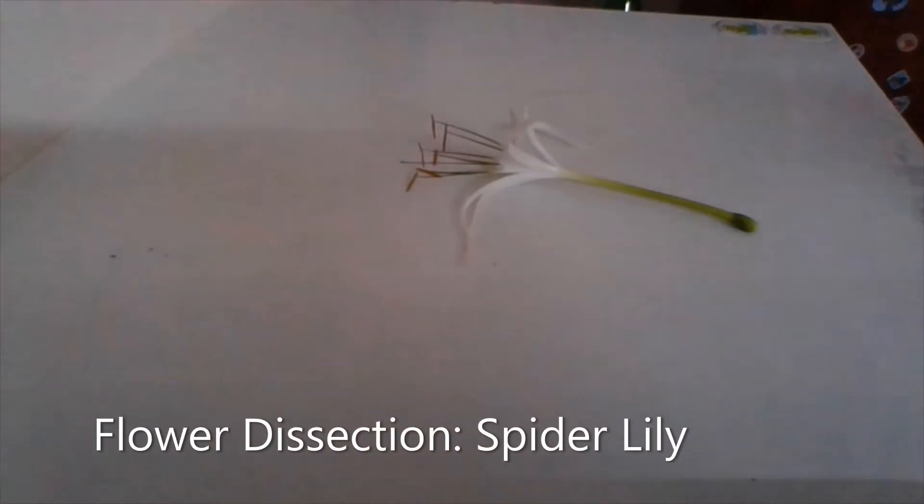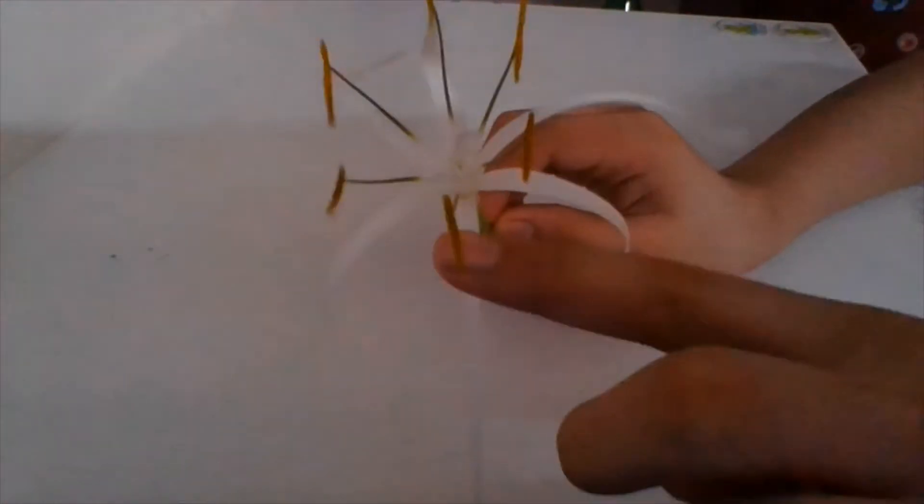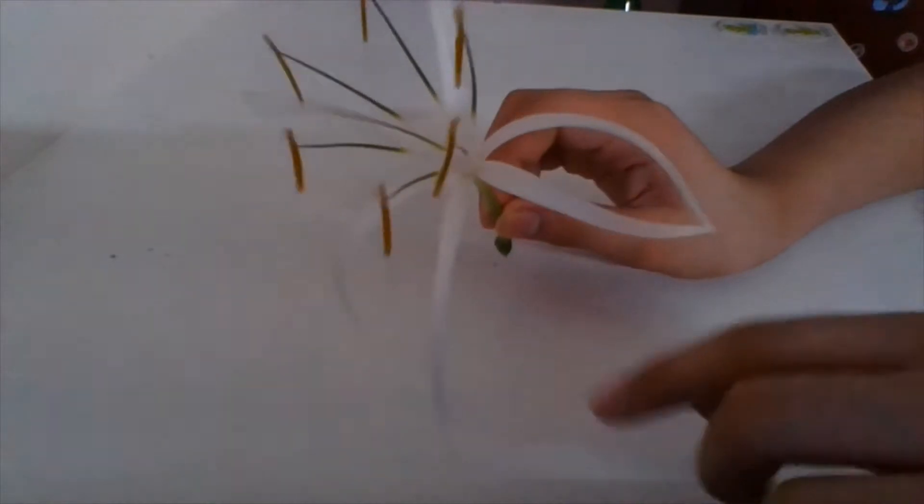Hello everyone, my name is Angad Singh and today I am going to show the flower dissection of this flower which is called water lily or spider lily. What you will be needing for the flower dissection is a flower similar to this one where you have all of these anthers very visible and the petals, along with the ovary at the bottom. You need a big flower and a sharp thing such as a compass or a needle to dissect it, and a magnifying glass.